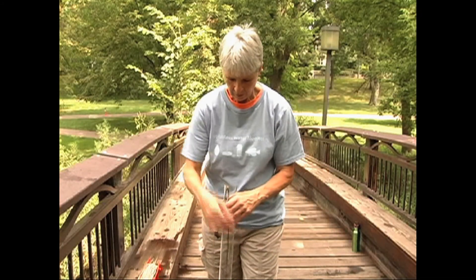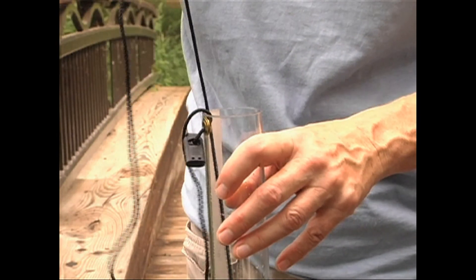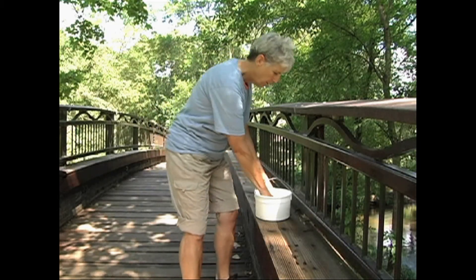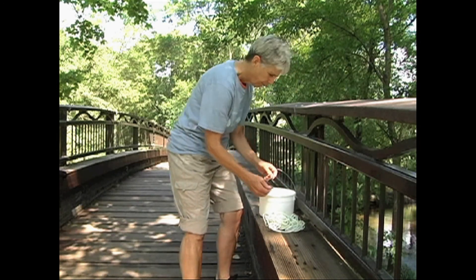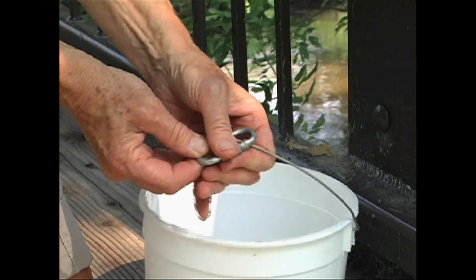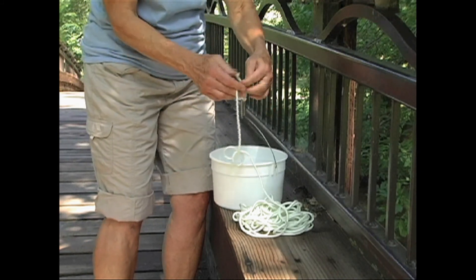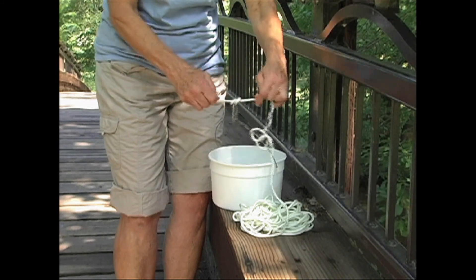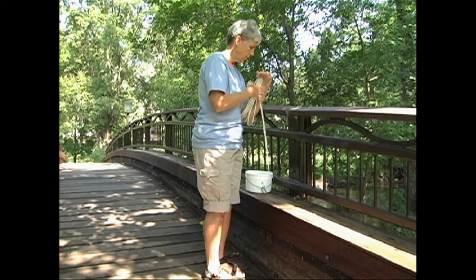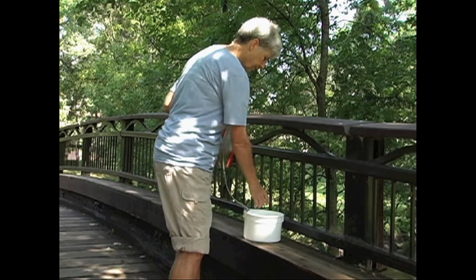In order to take a transparency reading on your stream, you'll use a Secchi tube. Start by preparing the tube. Pull up the inside string to remove the black and white Secchi disc from the tube. Then set the tube aside while you collect the water sample. You'll need a rope and bucket system to collect this sample. You can easily make one by attaching a threaded connector or quick link connector to the handle of a plastic bucket or ice cream bucket that has been cleaned. Next, tie one end of a strong, durable rope to the connector. A braided polyester rope will be easier to hoist than a nylon rope, which tends to fray and can cut and burn your hands. Make sure the rope is long enough to reach midstream and mid-depth from the bridge or stream bank where you'll be monitoring. If you need a particularly long rope for your sampling location, you might want to tie it to a reel so that you can roll up the rope as you pull in the bucket.